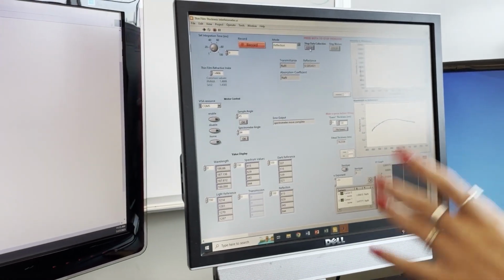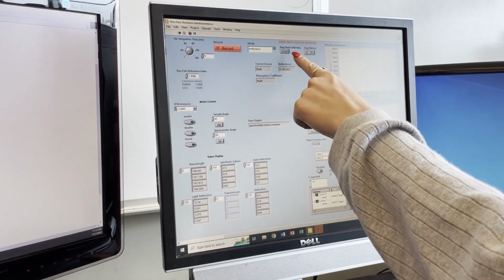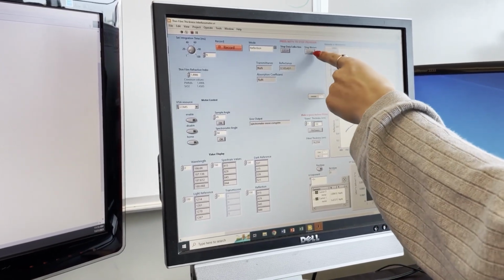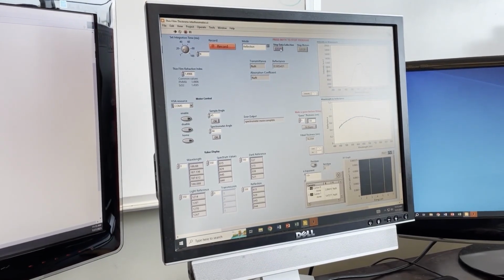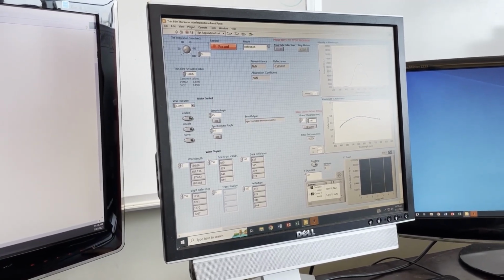Okay, and once you've decided that you're done, you're going to need to stop both of these buttons here, because you can stop both the motors and the communication with the spectrometer separately. So stop both, and then you're done.